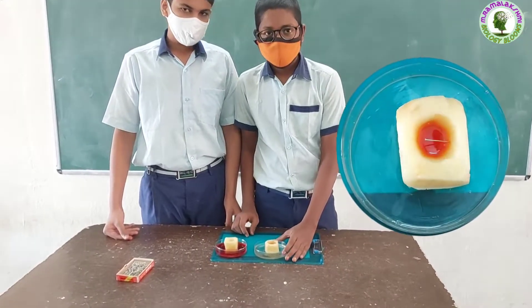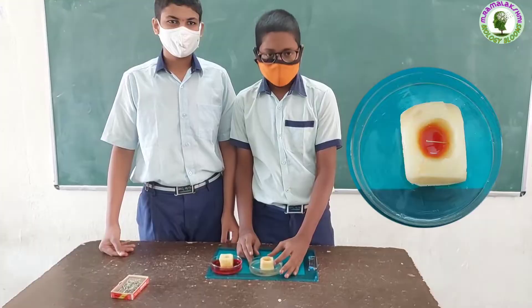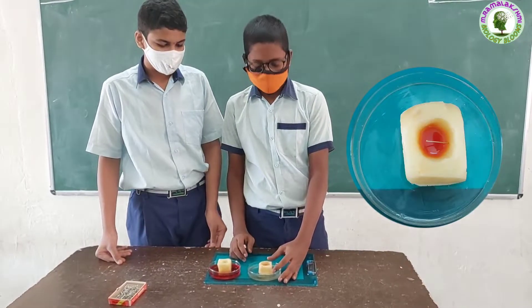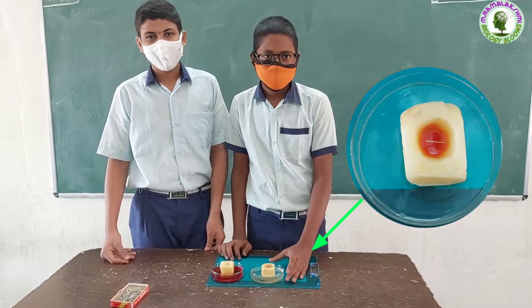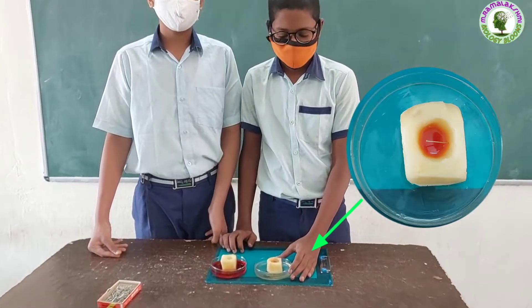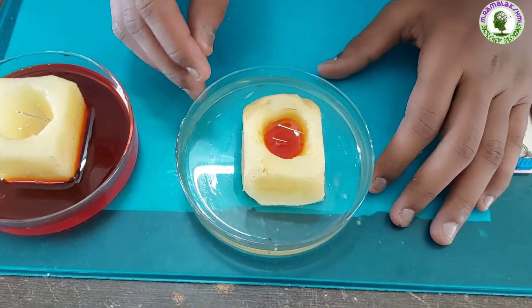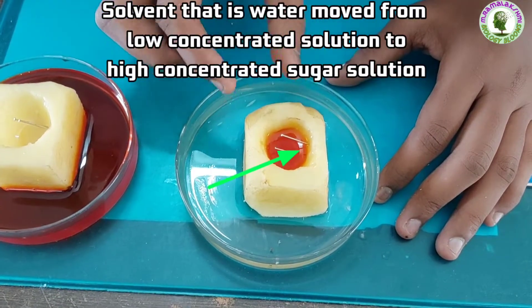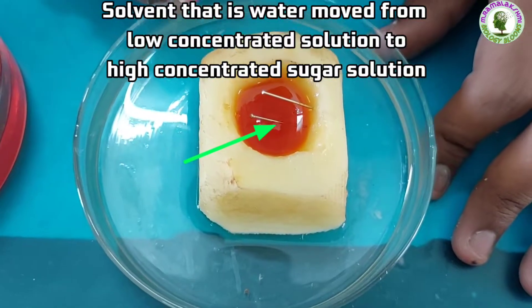Ramu, what did you notice in your experiment? I took high concentrated sugar solution in the potato cup and low concentrated water in the petri dish. After half an hour, I noticed that the sugar solution level in the potato cup has increased. Why, Ramu? The solvent, that is water, moved from the low concentrated solution to the high concentrated sugar solution, ma'am.